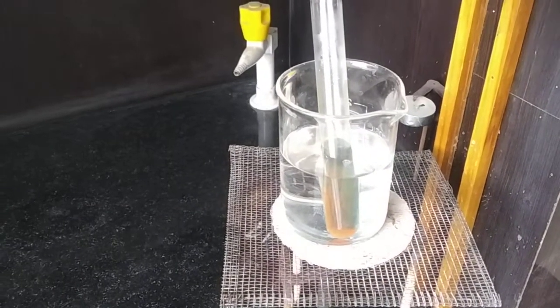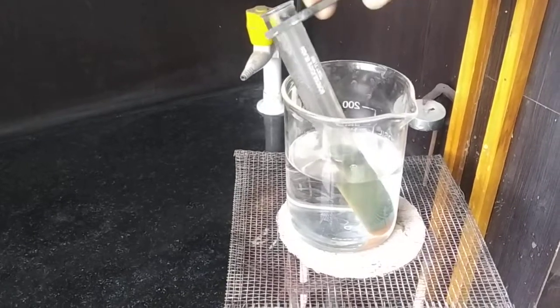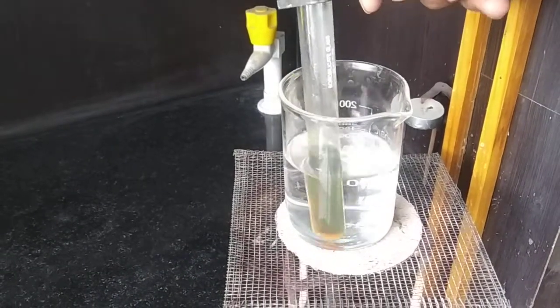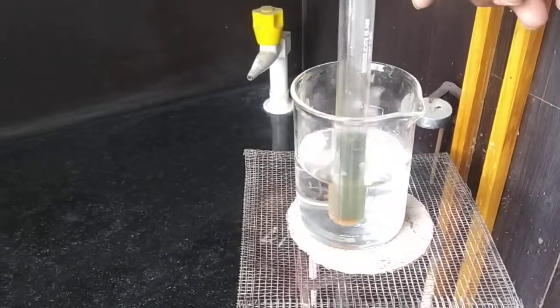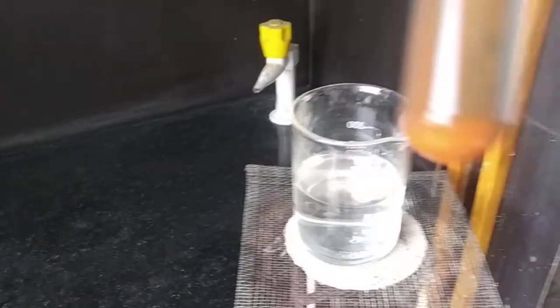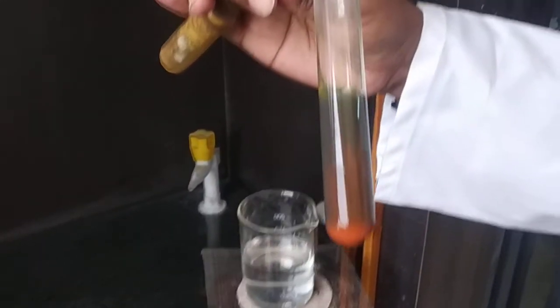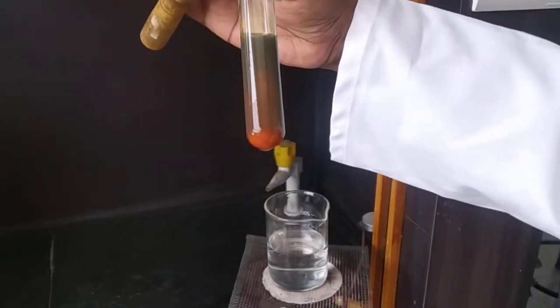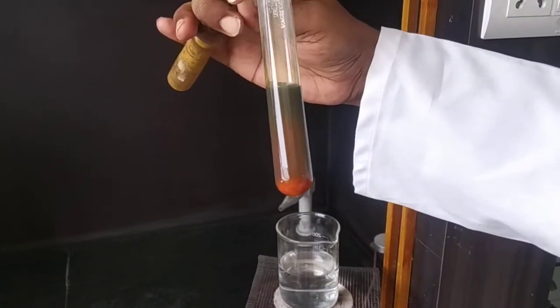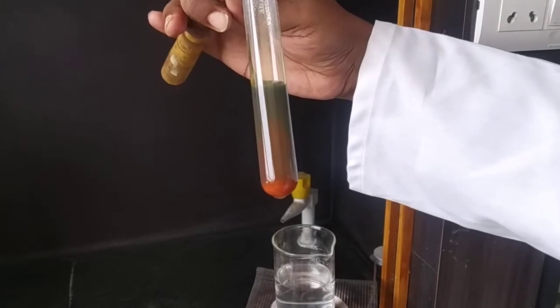Here you can see the solution has changed from blue to a reddish precipitate. The appearance of the red color shows that the aldehyde group is present in the given sample.